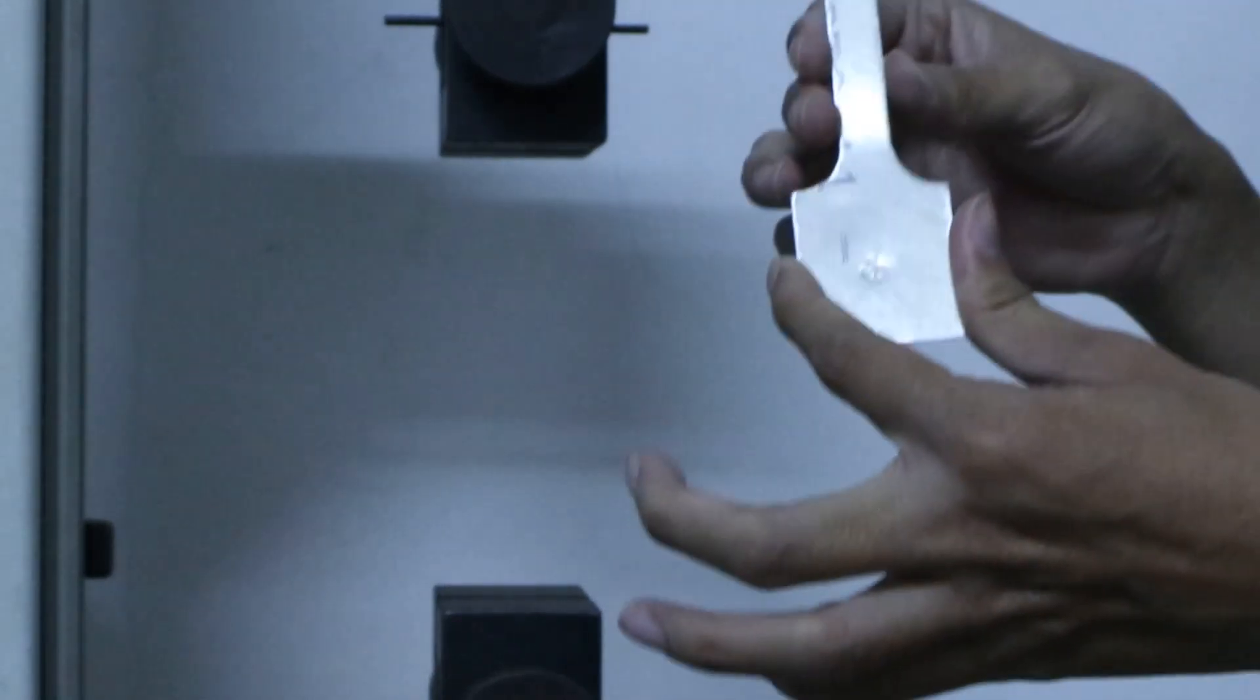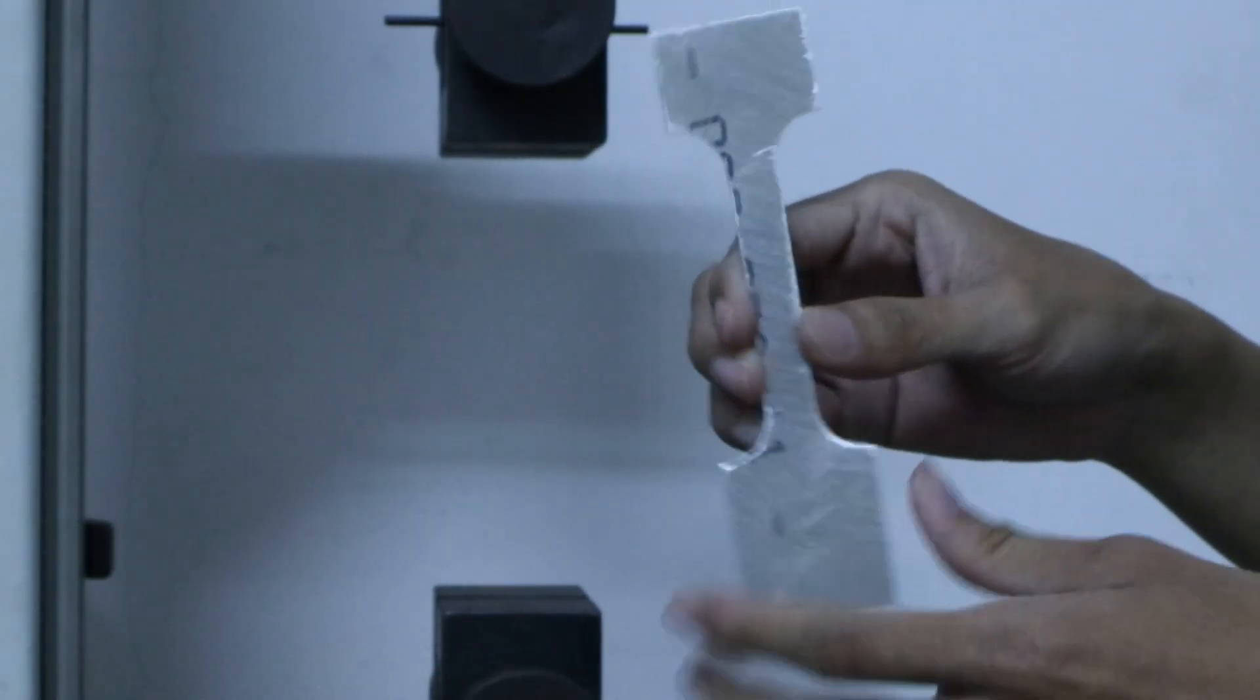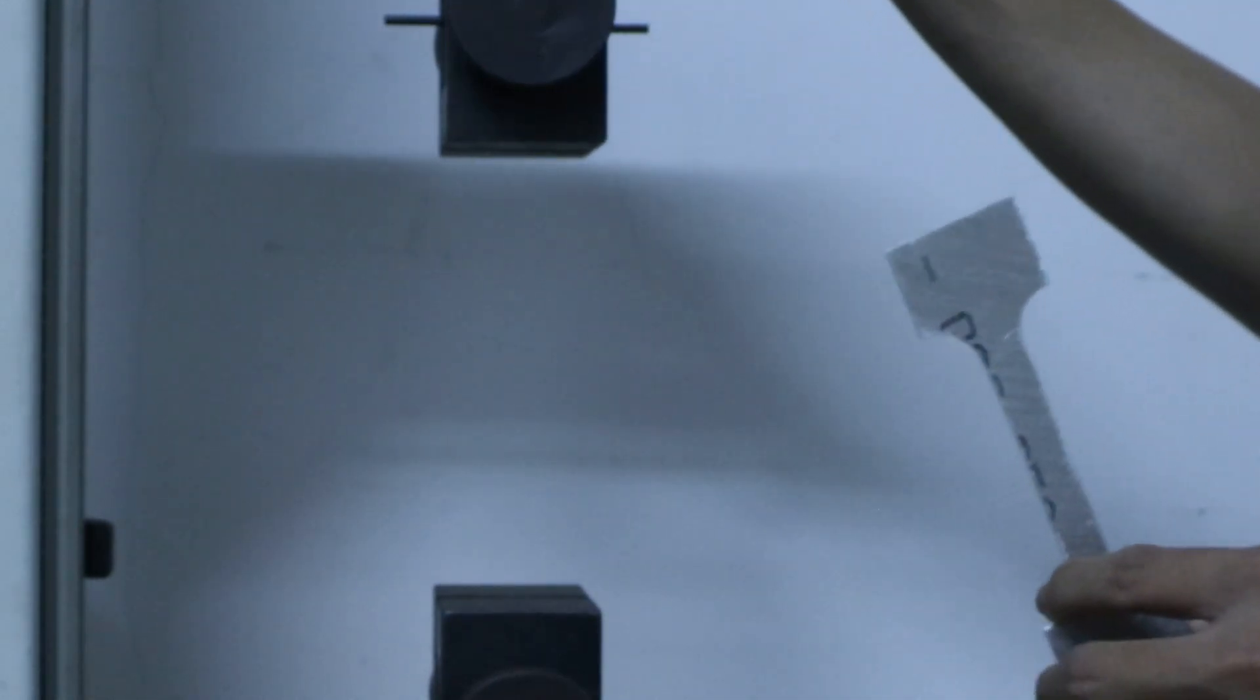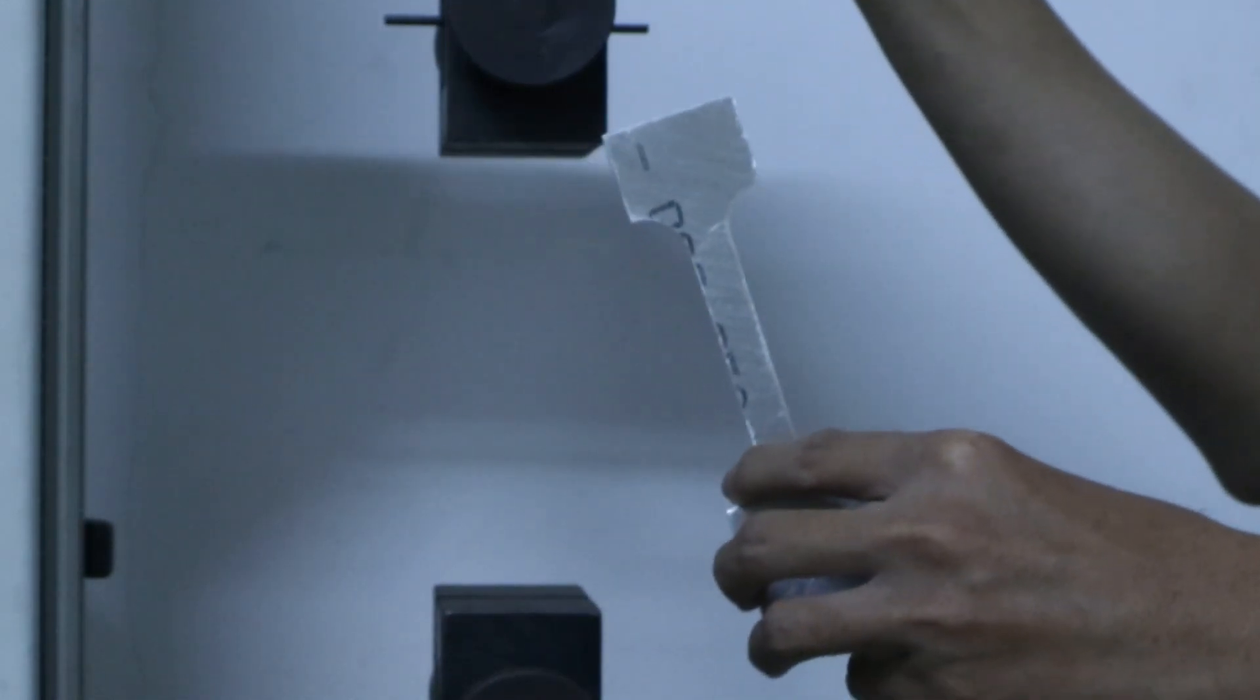Okay, so now we are going to put the specimen onto the clamp. We are using the Lloyd instrument with a maximum capacity of 5kN load cell.